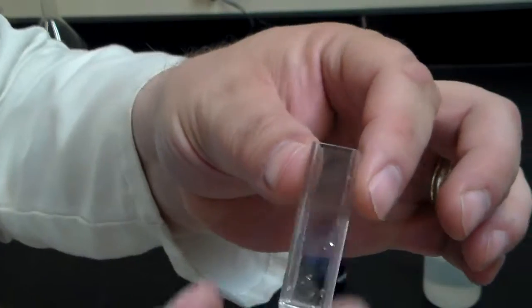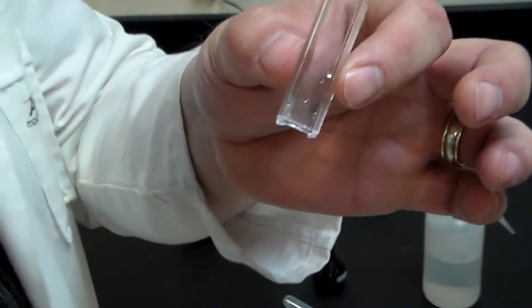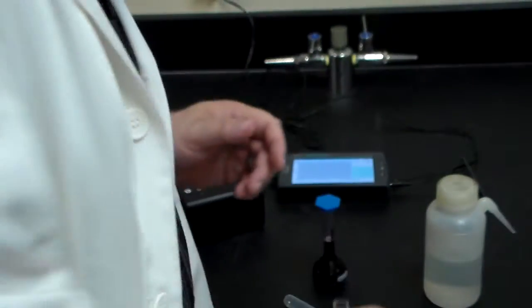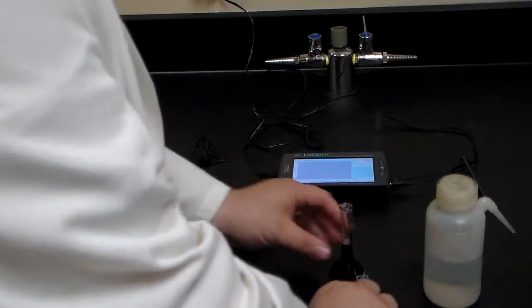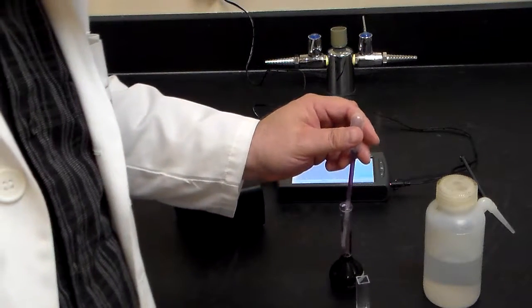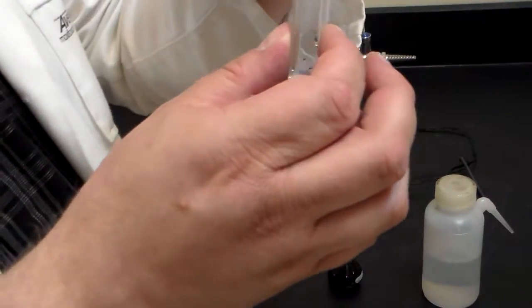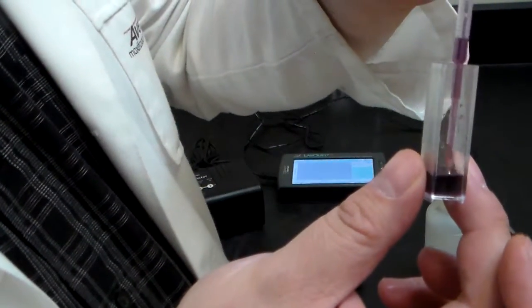So, how do we do this? Well, remember, you're going to hold on to the cuvette, and you want to make sure that it's clean. Now, I'm going to give you guys clean cuvettes, all right? So, put the cuvette down. We have our solution that we made just a few minutes ago. Pop that open. You're going to take your dropper, you're going to go in, and you're going to put it in the cuvette.